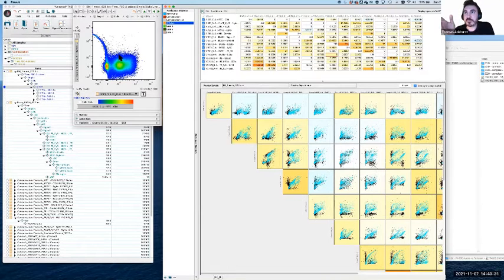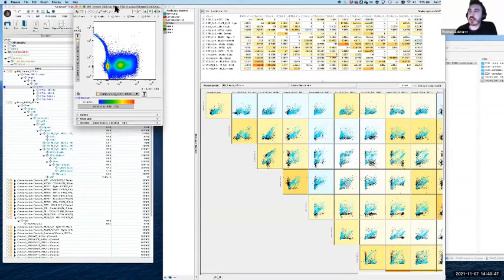So what I'm kind of trying to just show you here is the pattern. The type of curve that you see here is usually very indicative about which fluorophore is causing the problem. The first step is in identifying the issue. The second step is then how we methodically go about making corrections if we need to. And I'll make a bit of a comment on that in a second. But the first step is just identifying where there's a problem, and this is the type of pattern that we're looking for.